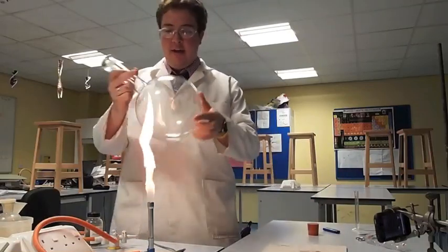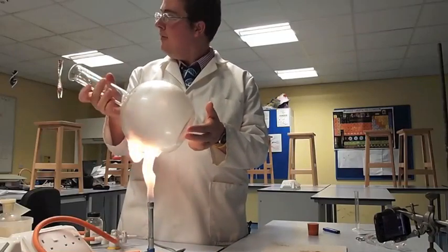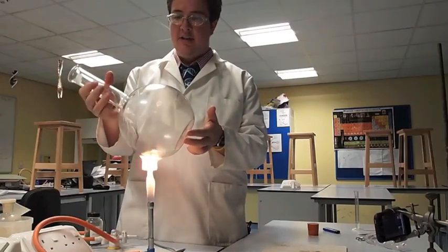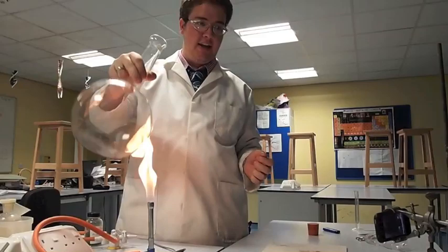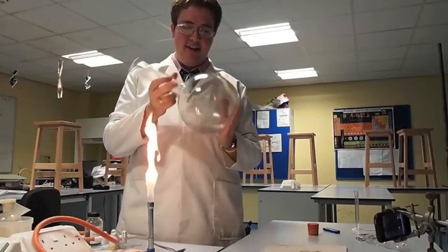Now, I'm going to make this work slightly better by gently warming my flask. Hello Mrs Mye. So I'm gently warming this because I want to evaporate the ammonia inside it. Nice bit of physical violence there from our head of science, that's what you need. Marvellous.